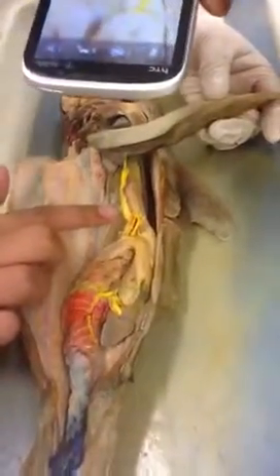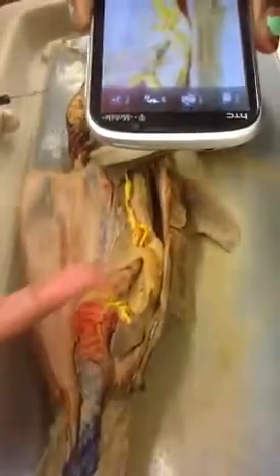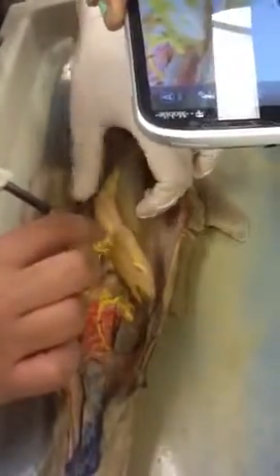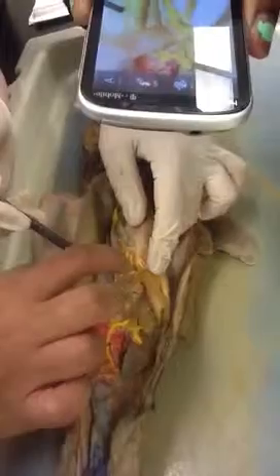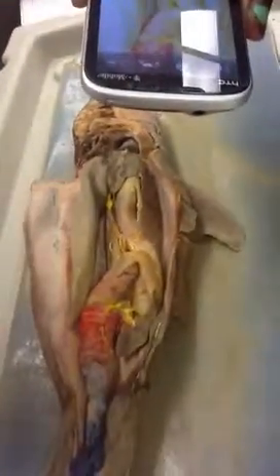And your celiac trunk artery goes up here, and it branches two ways. It goes to your gastrohepatic. Which one? You have to pull it down. It's hard to see, but it actually branches twice. Right here. So the one that goes down is the pancreatico-mesenteric. And the one that goes up is, for a short time, your gastrohepatic. Let me just double check. It's gastrohepatic. I think it's hepatogastric? Yeah, it probably is. Gastrohepatic? Yeah, I know, it's annoying. Even if you put hepatic gastric.